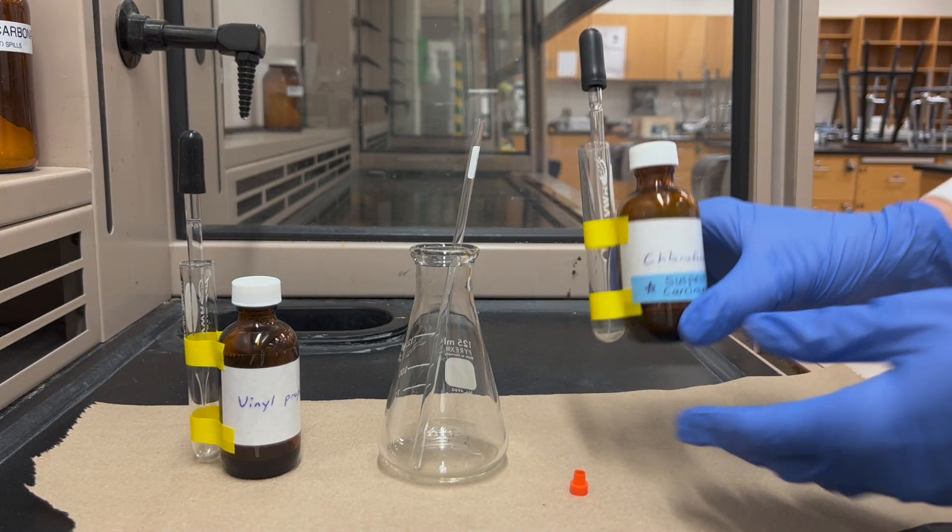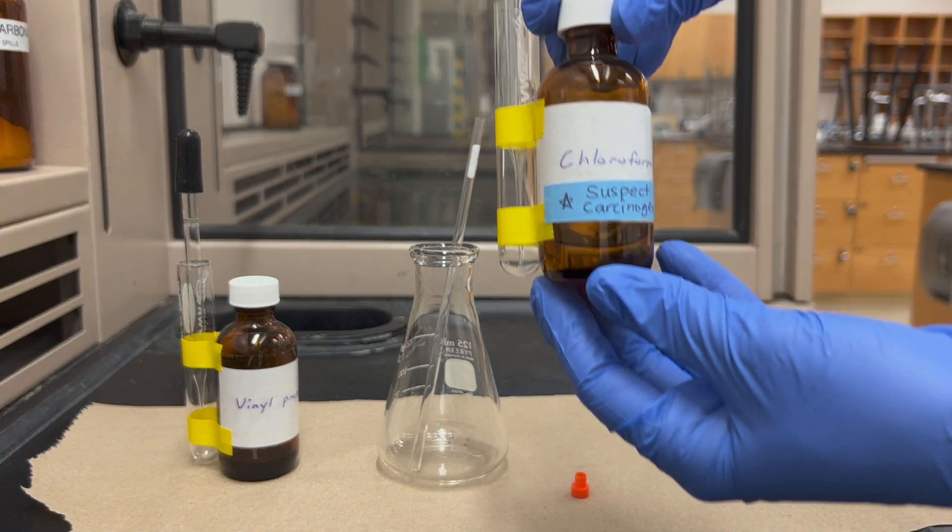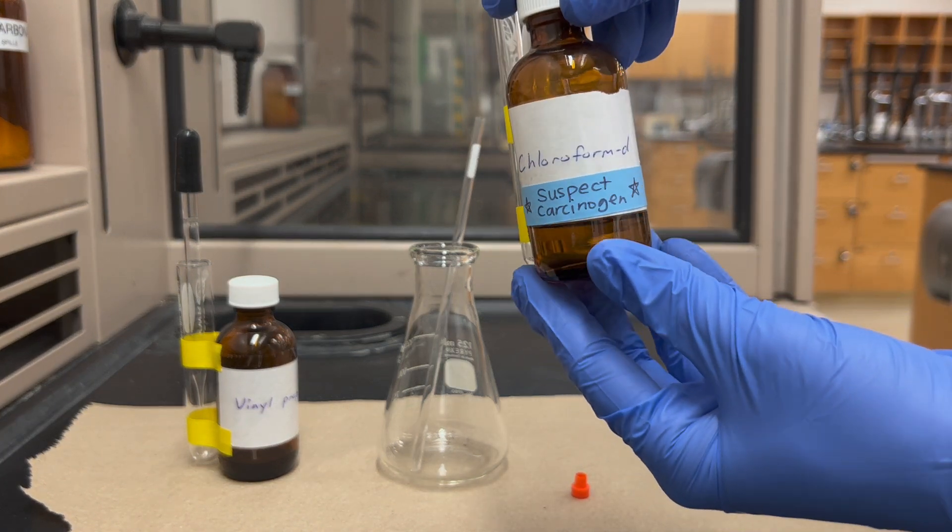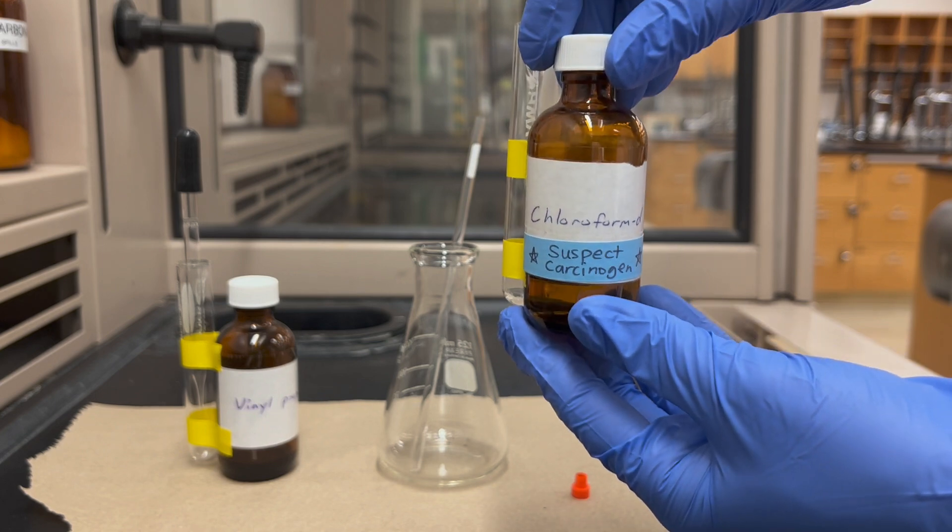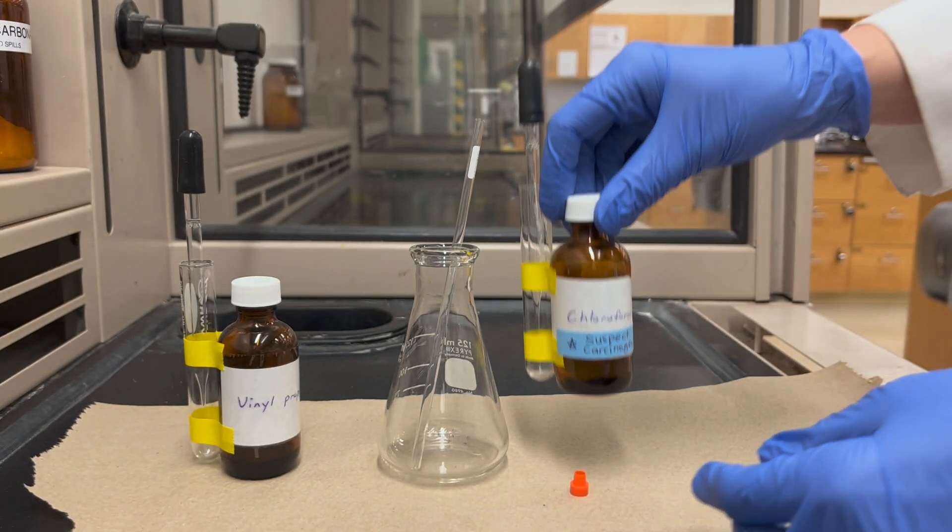I'm going to use deuterochloroform or CDCl3. It's a really common solvent for NMR but this is a pretty hazardous material. It's a suspect carcinogen, so when working with this you do want to wear gloves and work in the fume hood.